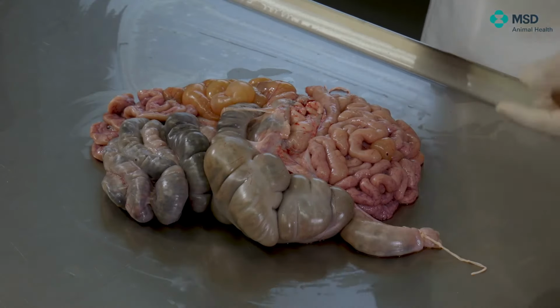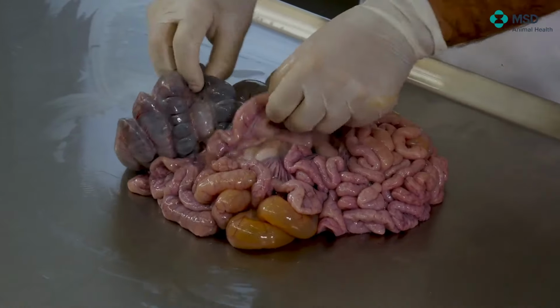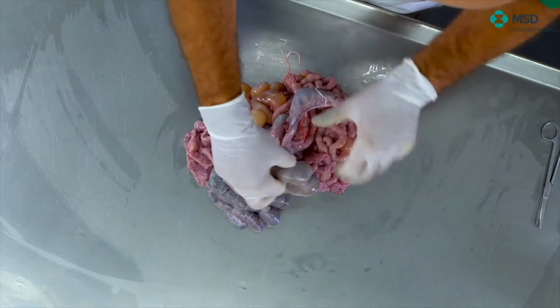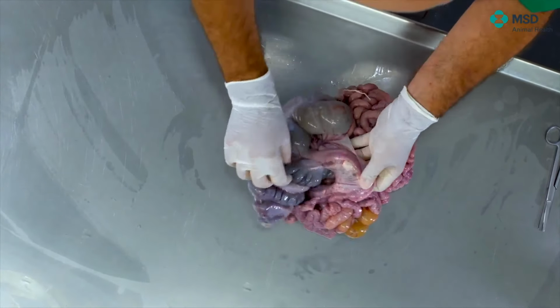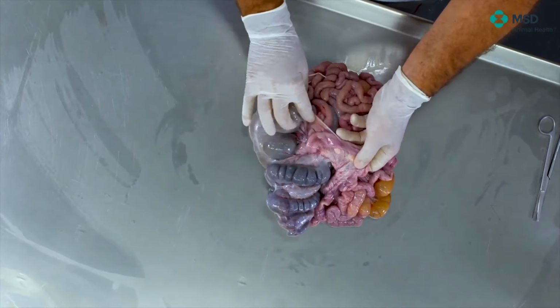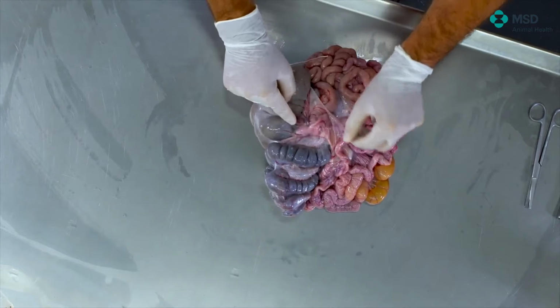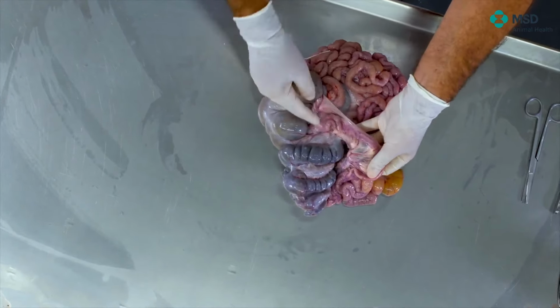So the easiest way to look for the ileum is by detecting the cecum. As long as we are detecting the cecum, and we can go for this side, we will find the ileum. So, as you can see here, we have the cecum, and here we have the ileum. So to detect the presence of the ileum should be easy. And if we are taking samples from here, we are pretty sure that we are trying to, in this case, for example, confirm or discard the presence of porcine intestinal adenomatosis.